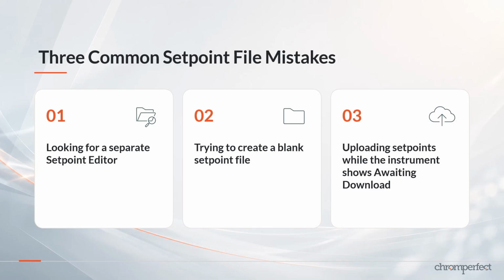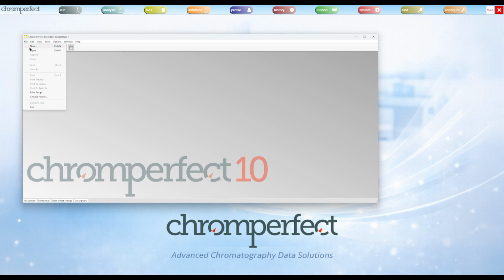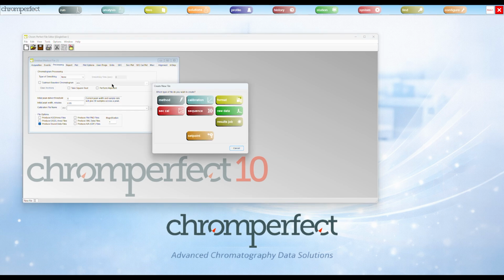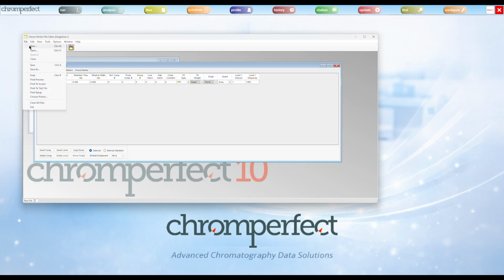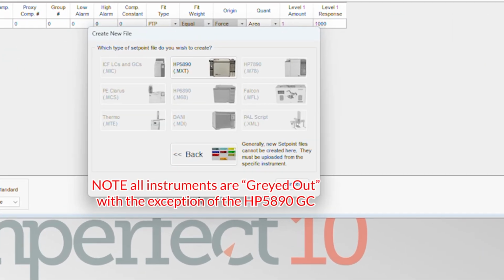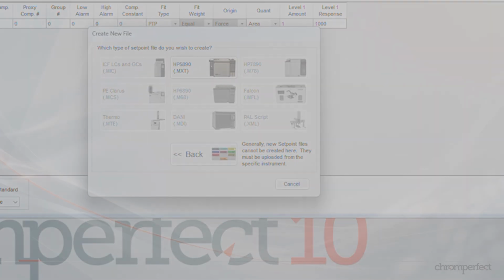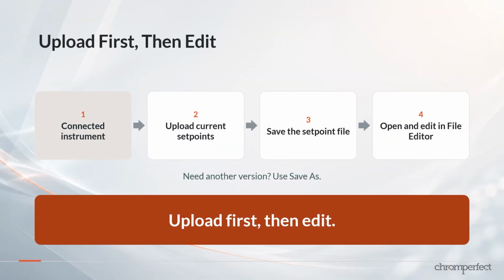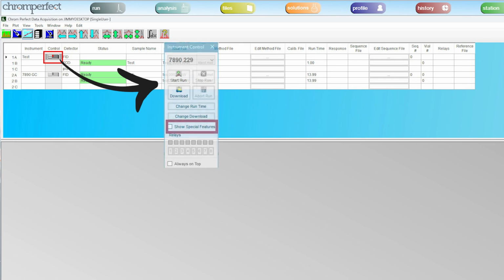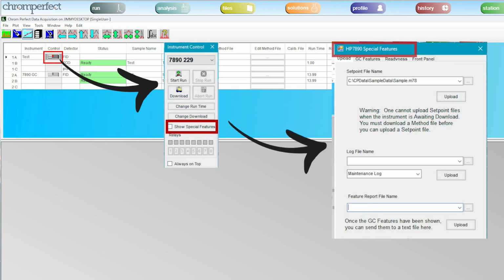The second common mistake is trying to create a new blank setpoint file. This is different from many other Chromperfect file types. A method file, calibration file, format file, or sequence file may often be created or edited directly in File Editor. Setpoint files are different because they are tied to the physical instrument and its current configuration. In most cases, the first setpoint file is not created from a blank template. Instead, it is uploaded from the connected instrument. This upload reads the current instrument settings and saves them as a Chromperfect setpoint file.